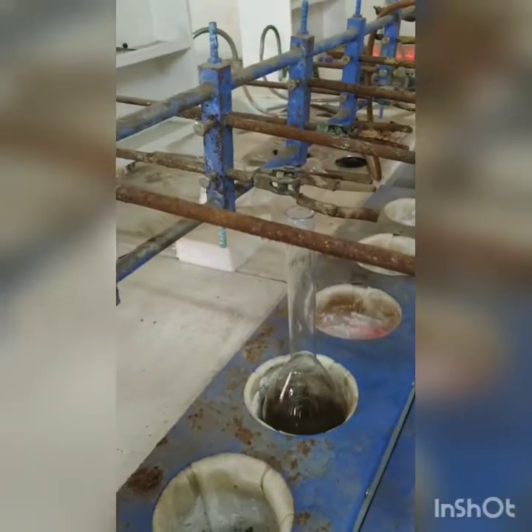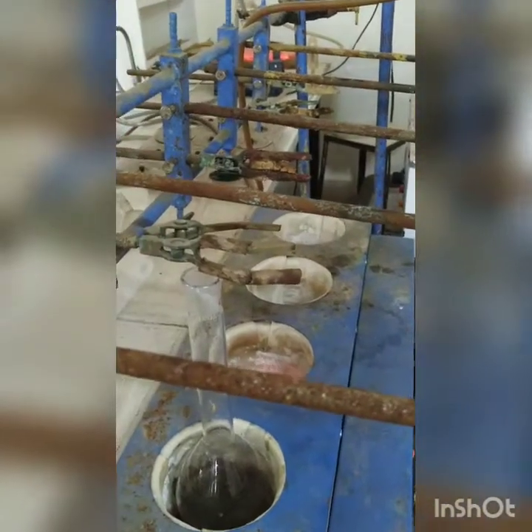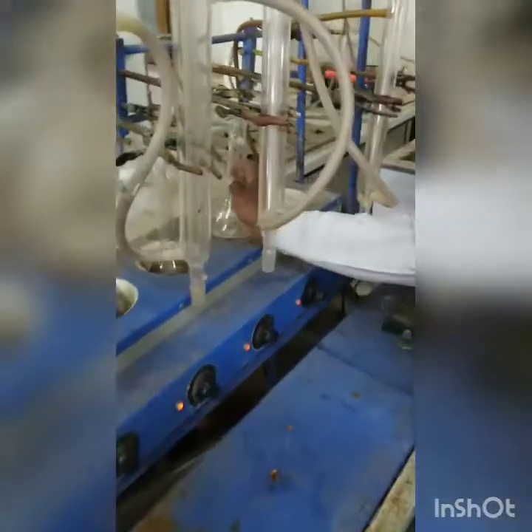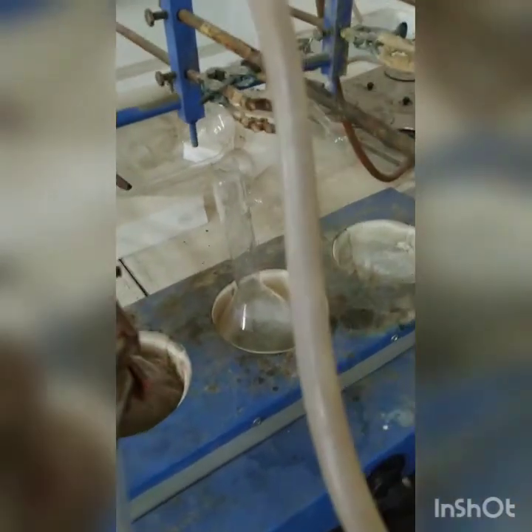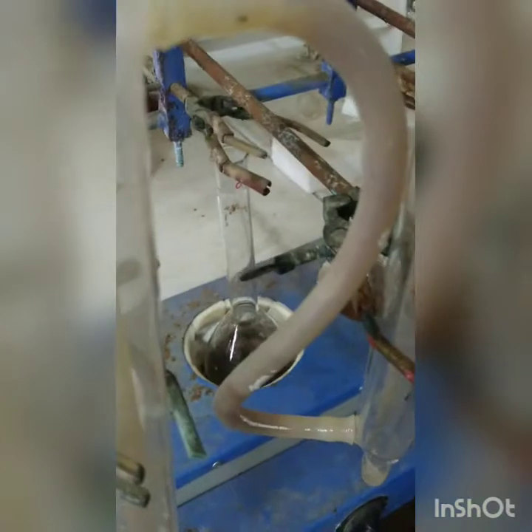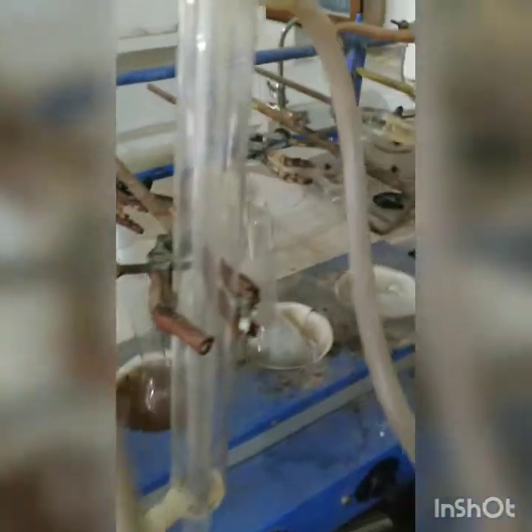Similarly, other 2 flasks will be prepared and they will be kept in the other slots for digestion. As we have done for the digester outlet sample, similarly we have kept the other sample, that is our grey water, and the distilled water as blank for comparison. So all the contents that we have added in the first flask for digester, that is say sulfuric acid, copper sulfate, then potassium sulfate powder, etc. So all those they have been added in the other two digestion flasks also, and now this has been kept for digestion.